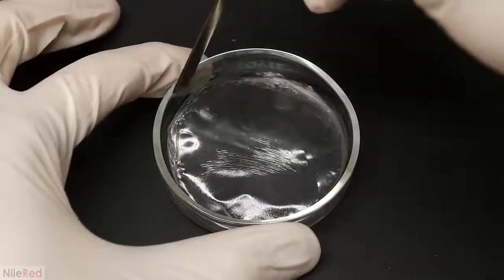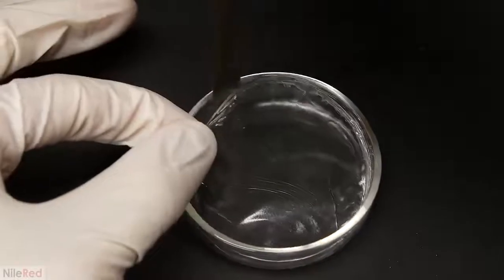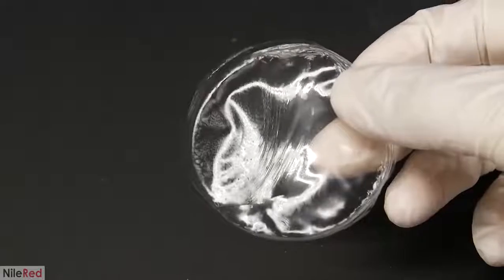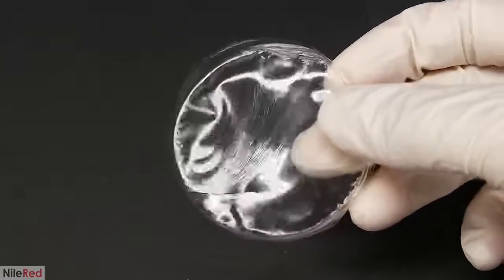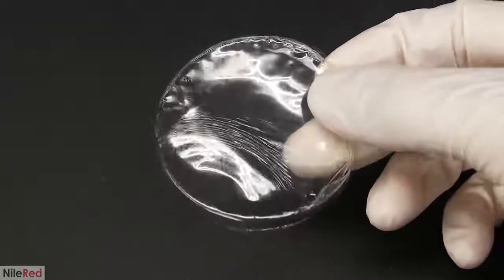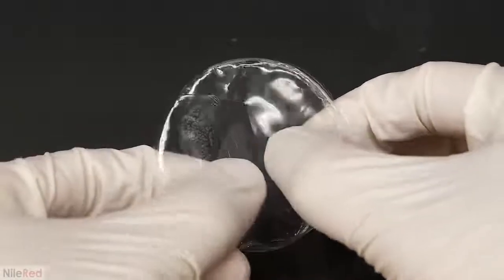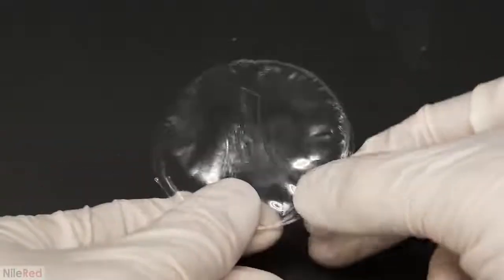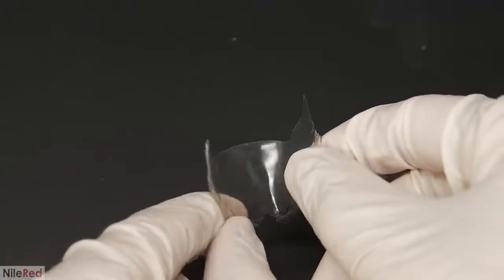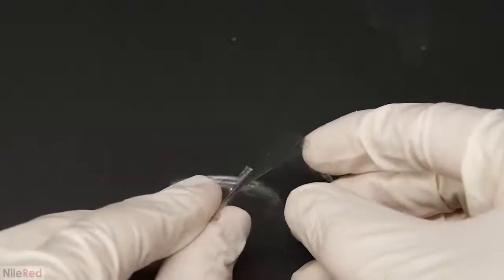I first look at the one in the dish, which turned out way better than I expected. I honestly thought it would just stick to the sides and be a complete mess, but it was extremely easy to remove. It's definitely not the most beautiful piece of plastic, but I was still pretty impressed by it, considering it did come from filter paper. In terms of strength though, it's quite brittle and it breaks very easily. When I go to just bend it a little, it completely snaps in half. I tried bending and testing one of the halves, and at first it seemed to be a little bit more flexible, but then it quickly broke.